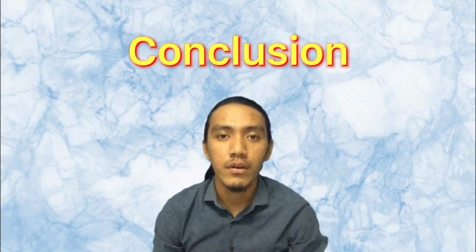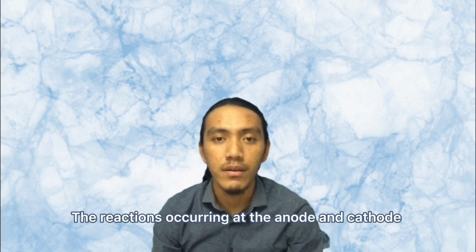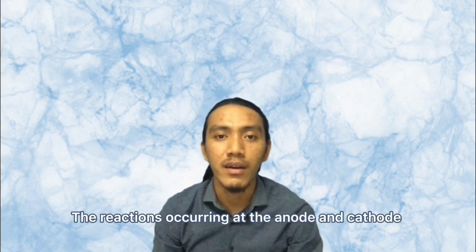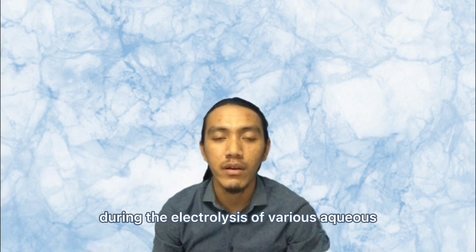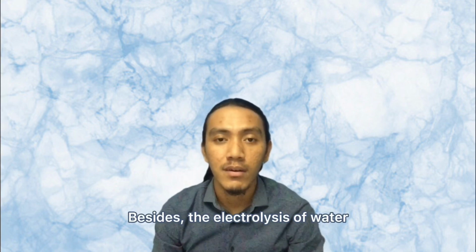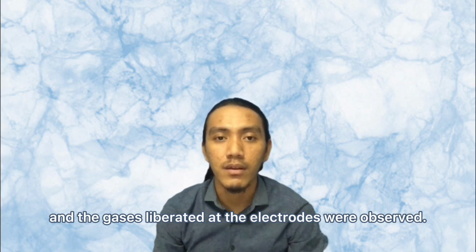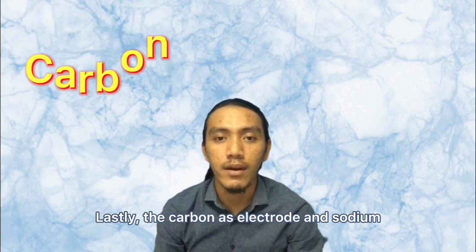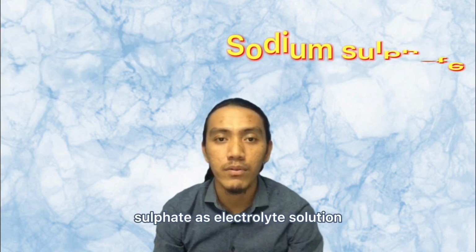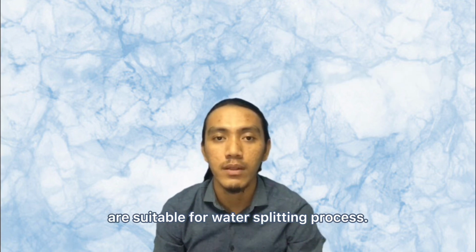In conclusion, the objectives of this experiment were achieved. The reactions occurring at the anode and cathode during the electrolysis of various aqueous salt solutions were identified. Besides, the electrolysis of water and the gases liberated at the electrodes was observed. Lastly, carbon as electrode and sodium sulfate as electrolyte solution are suitable for the water splitting process.